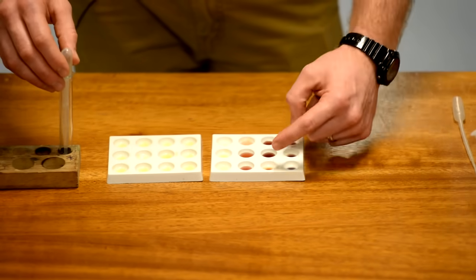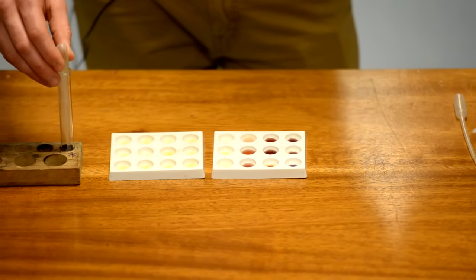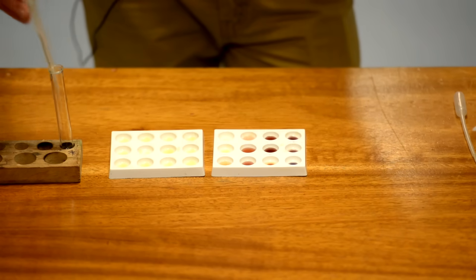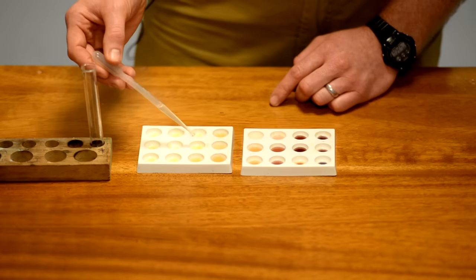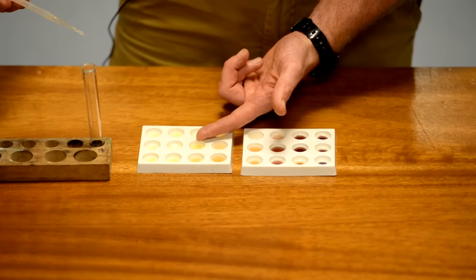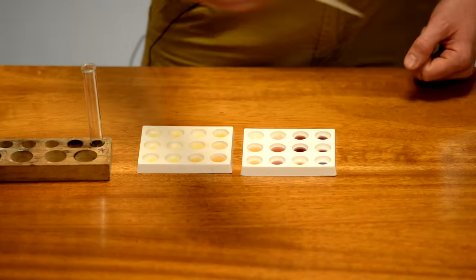As you can probably see there's a slight difference in the colour as the time is going on. It's getting lighter each time and at this stage there is no colour change meaning that all the starch in the solution has been digested.